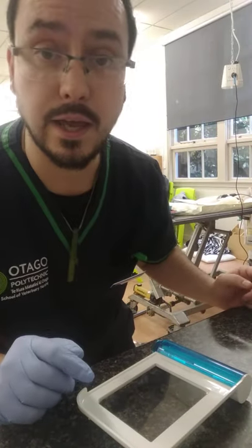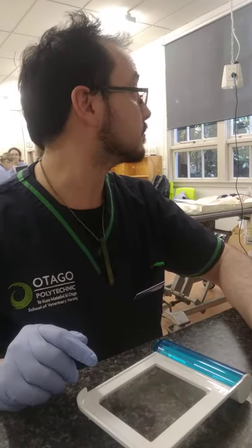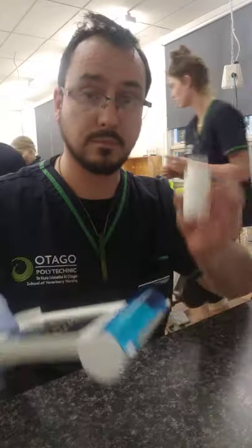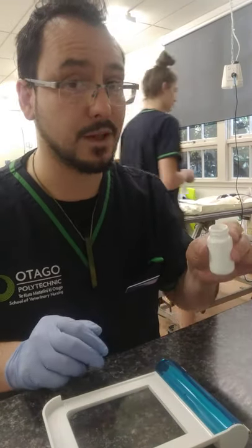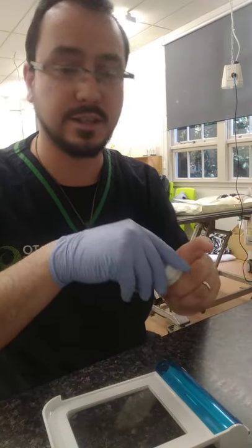And I have a container for myself. I will use this and pour it in there using the lid that I just took off. Nothing fell out — that's very lucky. Now, that's the end of the sterility that is needed, so I can use a glove hand.